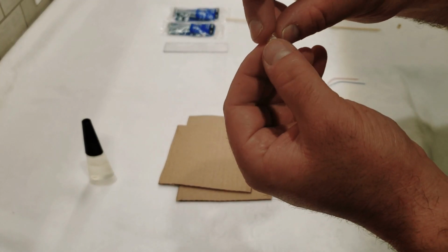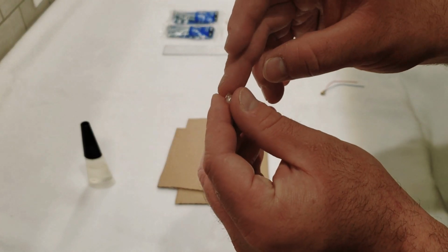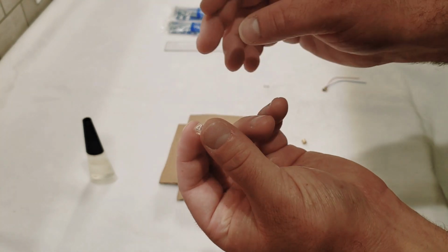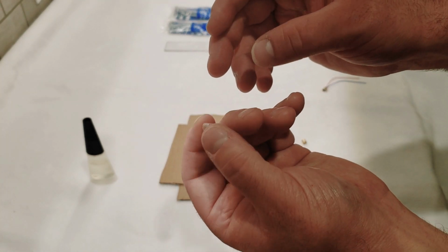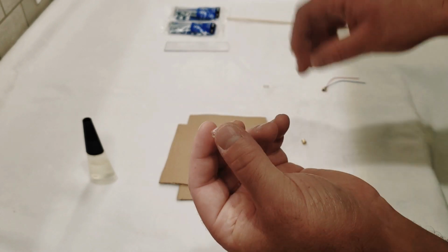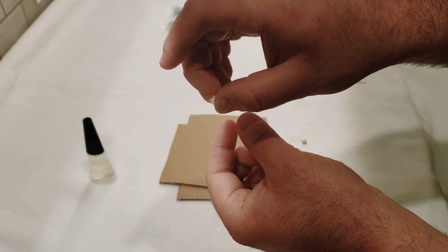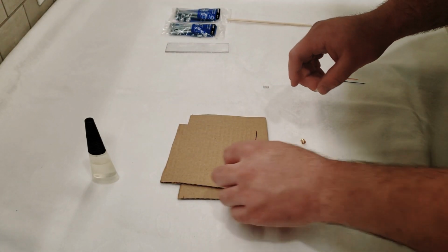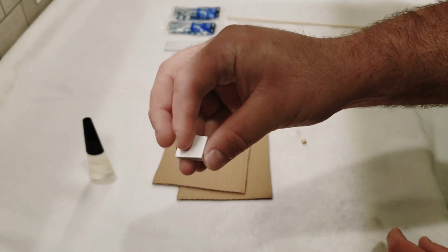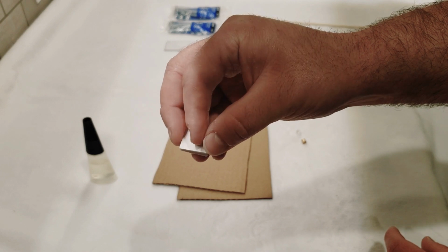It looks like the video cut out there for a second, but we rolled it up in that tube of tape, cut off the ends, and what we're left with is just these two lenses stacked on top of each other in the tape. And now, because I want it to be a little easier to mount to the phone, I'm going to cut a hole right here in this foam that's got just some sticky tape on the back.